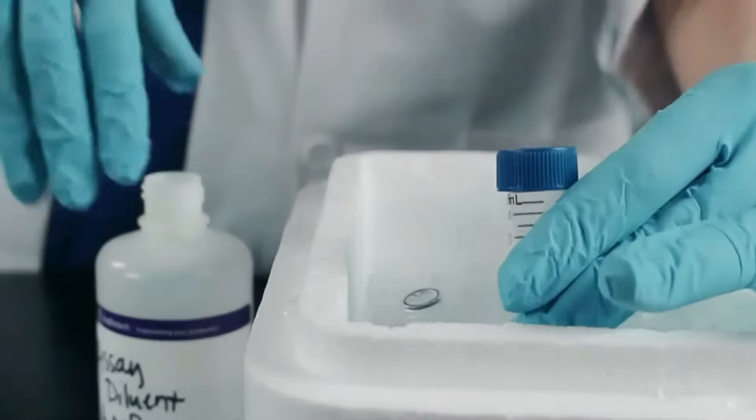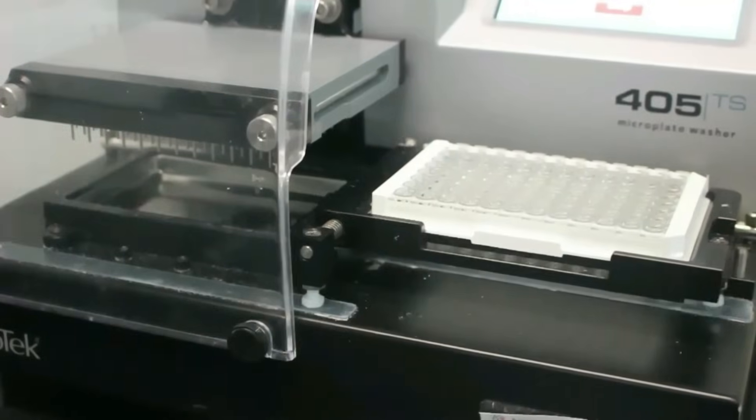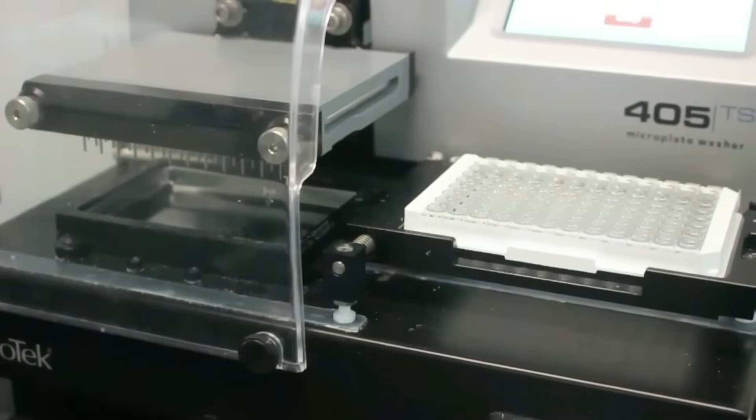We use a plate washer, but many times, if you want to minimize background, it is best to pipette wash, especially if your neighbor's plate washer hasn't been cleaned in a while.